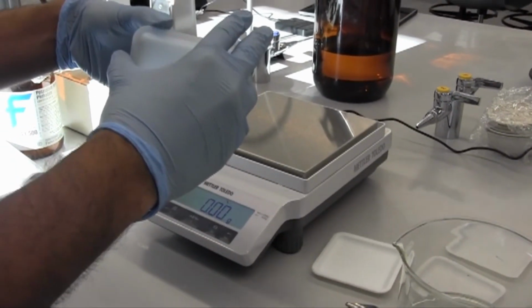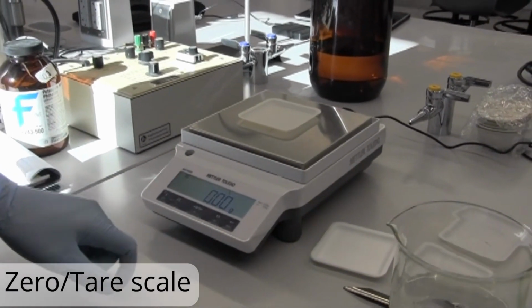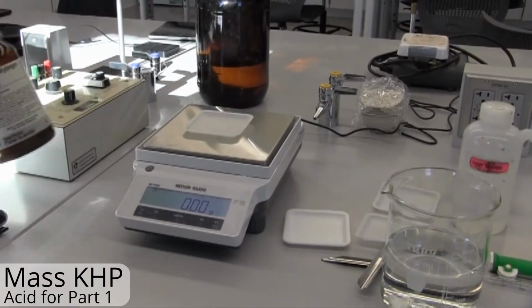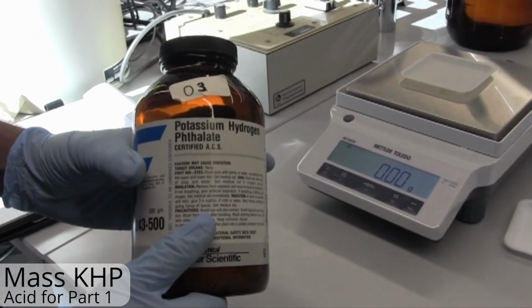And next, we're going to go ahead and weigh out our KHP. We need to first zero our scale and then mass an amount of KHP, our known acid in this case.